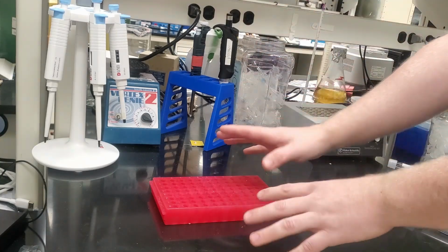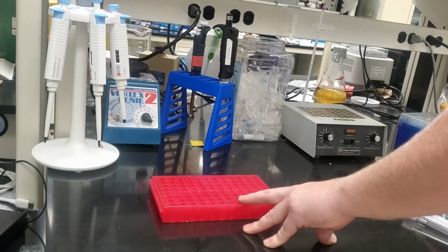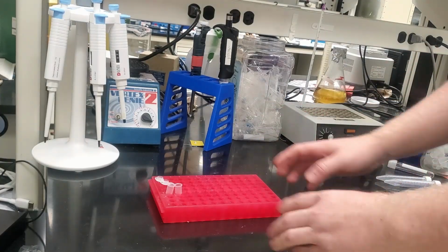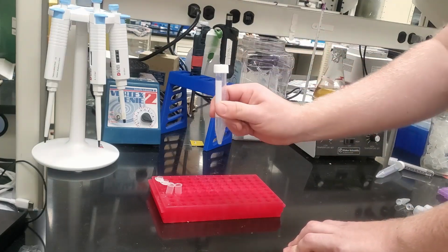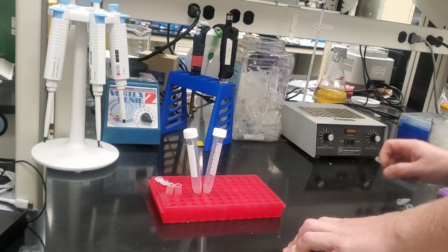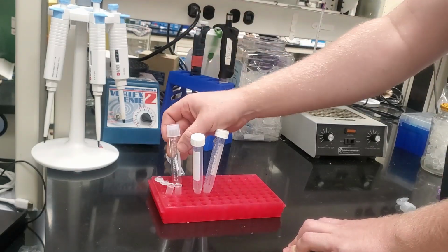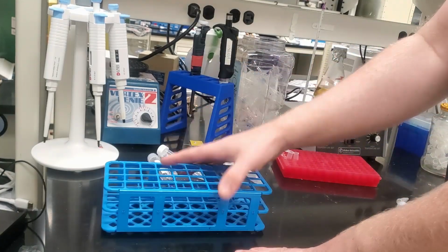So what is that? This is the tube rack. Found in every single lab that you've probably ever heard of, it holds tubes. Problem solved. That's its whole function. But what if we want to hold these tubes? Well, almost works, a bit precarious. These tubes, you're just out of luck. What you need for that is to get a whole separate tube rack.